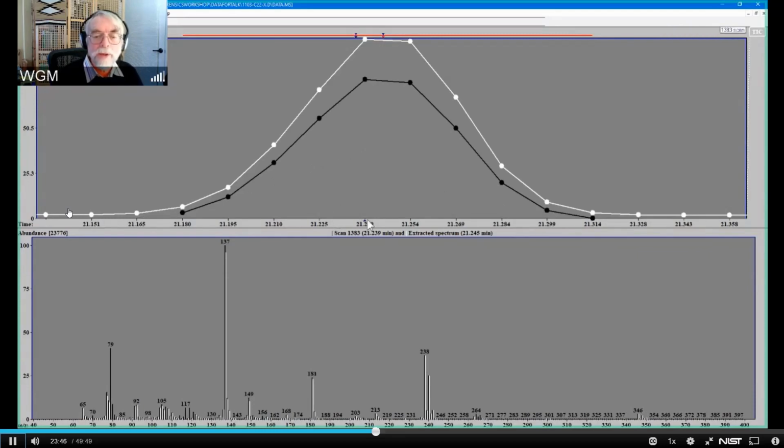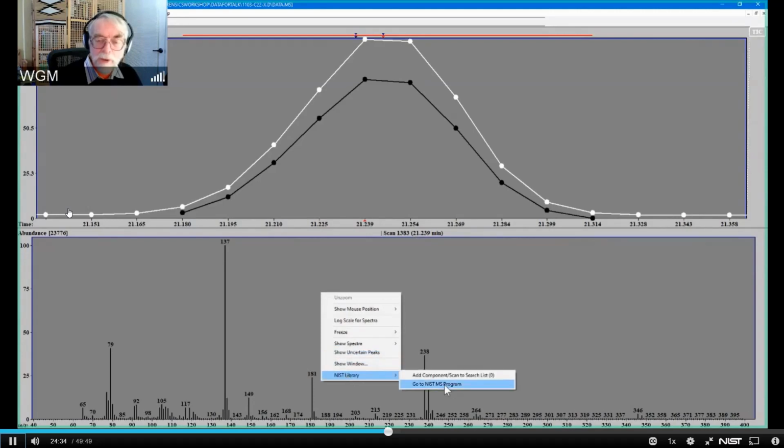But what I want to demonstrate here is how to use this. I could search each of these with the mass spec database, and maybe I'll come back and do that. I could actually make use not of the identified spectra, but of the spectra that have been deconvolved. But what I want to demonstrate here is this whole idea of doing a spectral subtraction within the framework of the NIST database. So I'm going to do a search with this spectrum, which is the raw data. You'll notice I got that by clicking down here. I'm just looking at a single scan, and I'm going to go to the NIST library and search it.